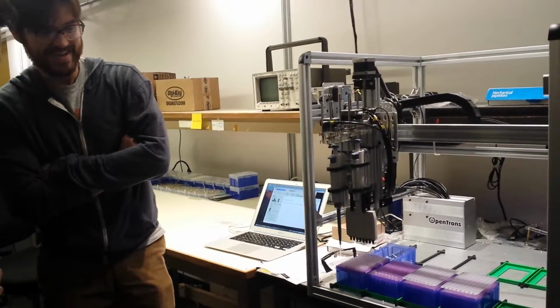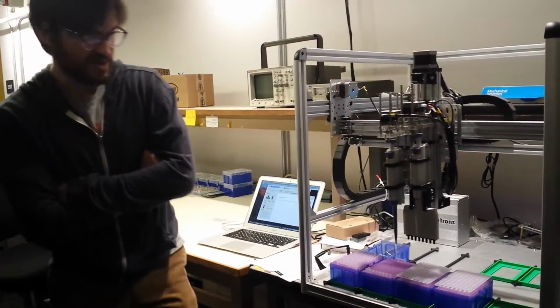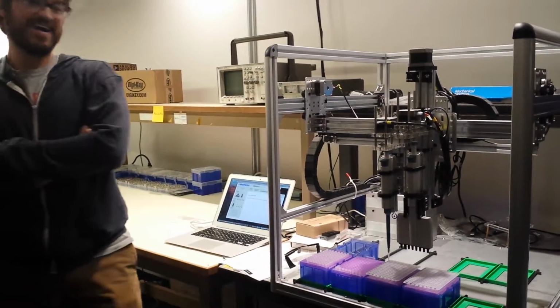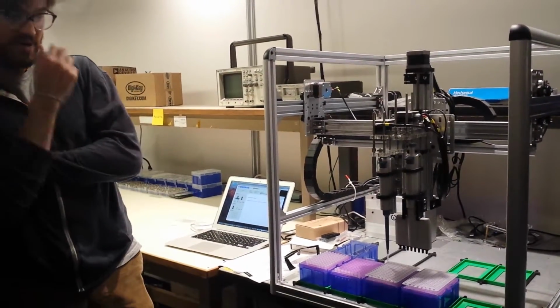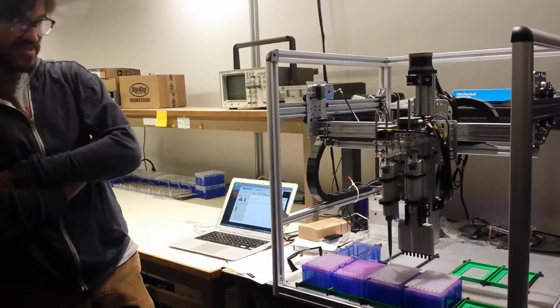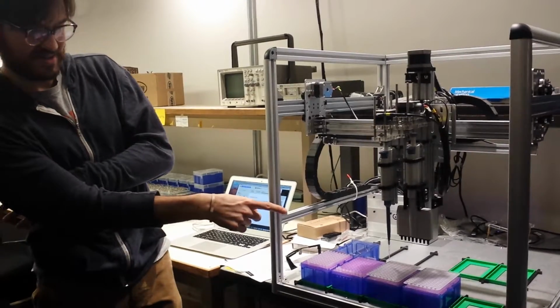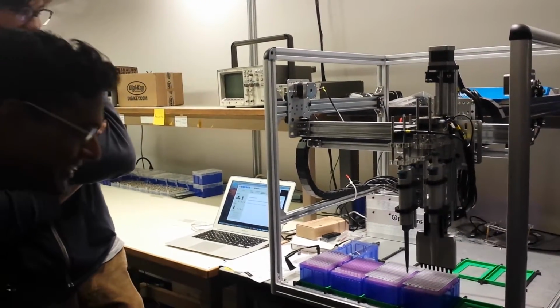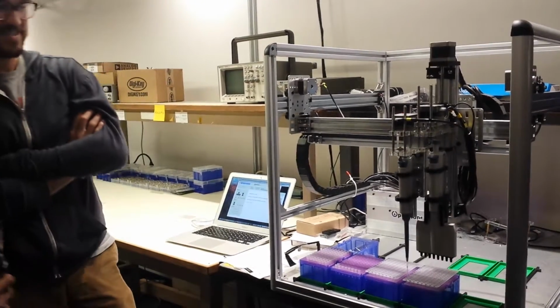It's a very slow robot. Yeah, it's a slow robot, and I'm actually a little nervous because we didn't... Oh, it's still working. Okay. Because it gets miscalibrated very easily. So if we're not using it that frequently, sometimes you can see it's not directly centered, that well, when it took the liquid out. You have some good eyes there. No, okay, I see what you mean. So it's just barely. Yeah.